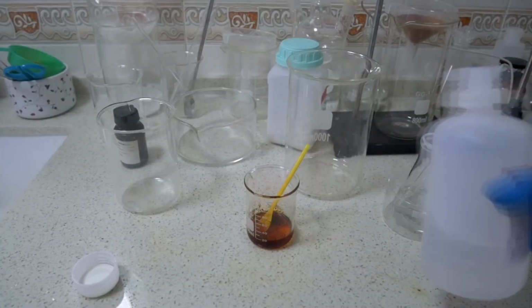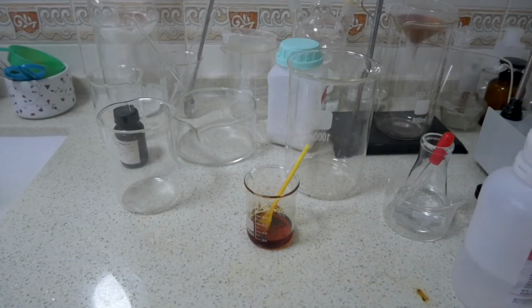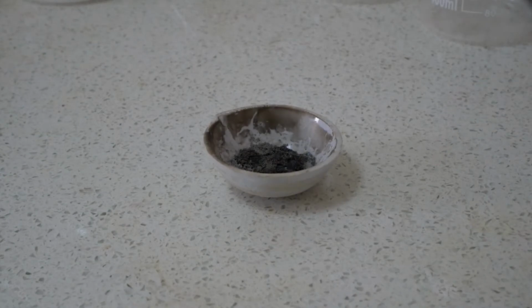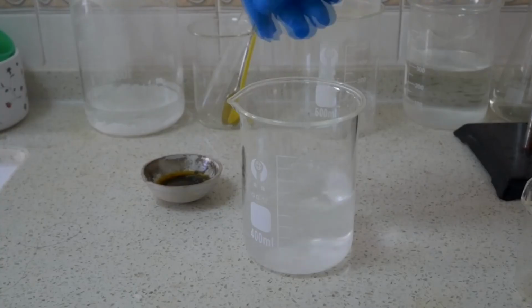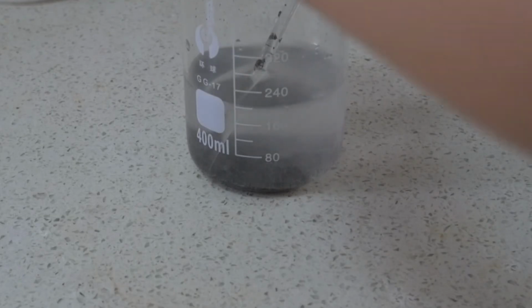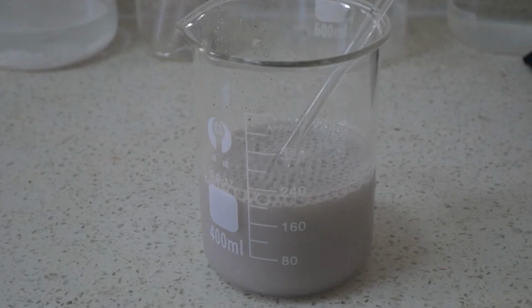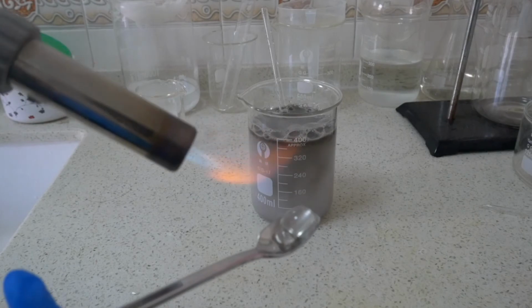When the reaction is done, I left the crucible for a few days. I used ethanol to clean the beaker that contained the iodine powder. To deal with the waste in the crucible, I threw the leftover aluminum powder into sodium hydroxide solution to destroy it. It creates a lot of hydrogen gas bubbles. Well, I think it's pretty funny.